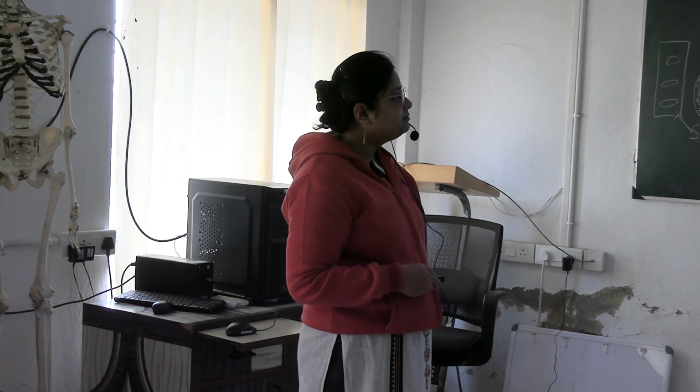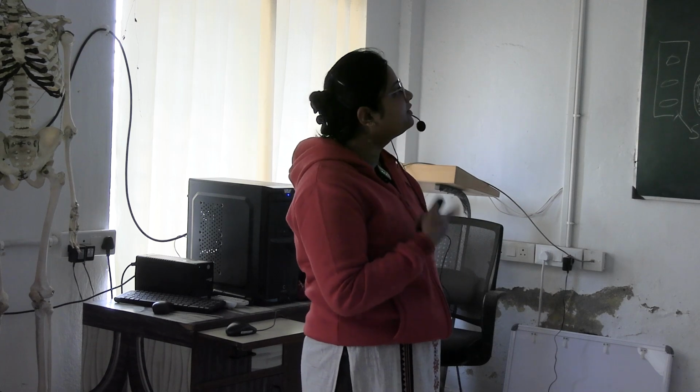Smooth muscle layer is present between mucosa and cartilage in the bronchus. Here it is present between mucosa and adventitia. Cartilages are irregular plates of cartilage in the bronchus. Here cartilage is absent. Seromucous glands are present in the submucosa. Here glands are absent. So these are the differences between bronchus and bronchiole. It comes in theory or is asked in your viva and OSPE.